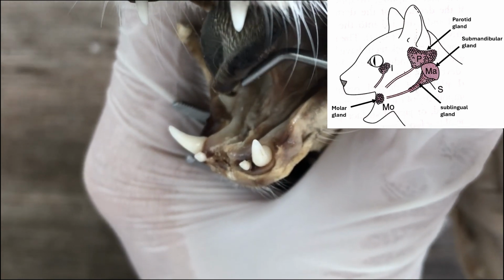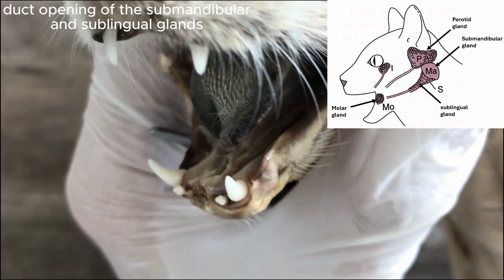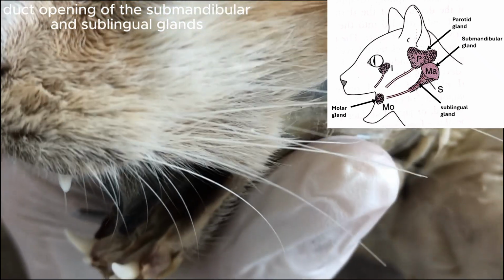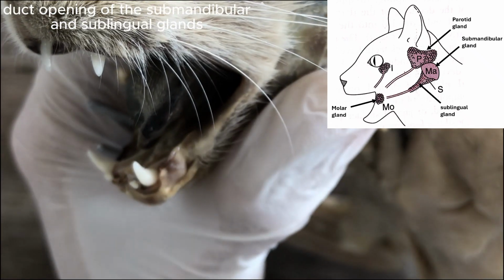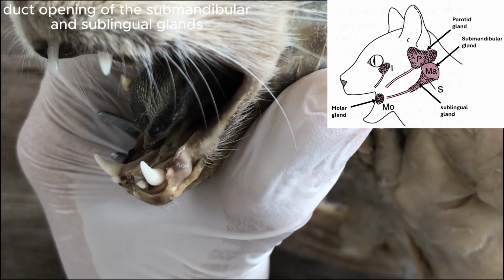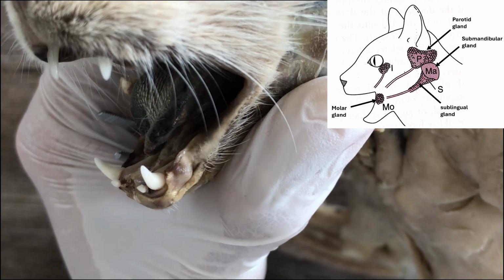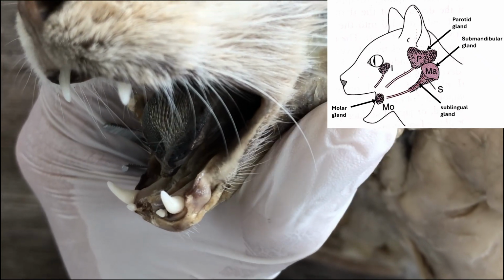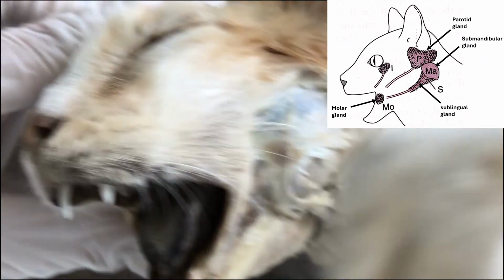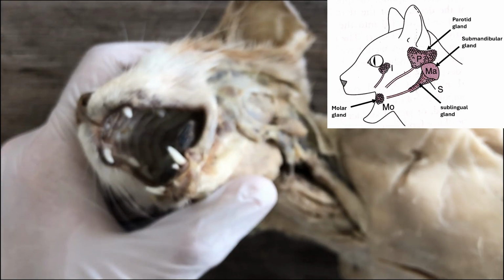There are two little knobs. Those papillae are the location of the ducts of the salivary glands, of the submandibular and sublingual, sorry. So that's where they secrete the saliva, right? And then that's the third salivary gland.